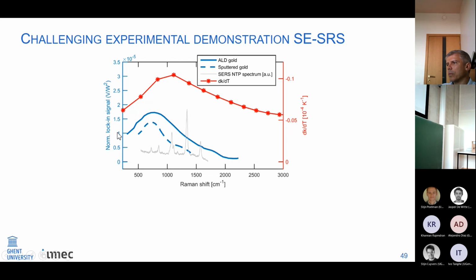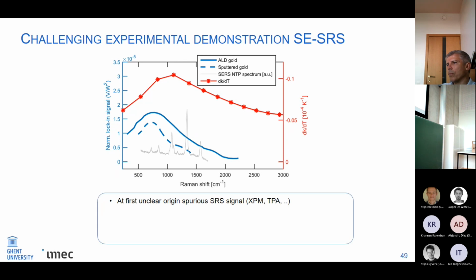And it's basically those blue curves here, and you see, okay, they do not overlap. Those measurements are for two types of gold deposition techniques, ALD gold and sputtered gold, and I could measure that spurious spectrum in one case, and even when I didn't apply any analyte. So then I was thinking, okay, maybe again we have a spurious SRS signal due to cross-phase modulation, or otherwise you also have two-photon absorption. But transient absorption is something else which is commonly seen as a spurious signal.